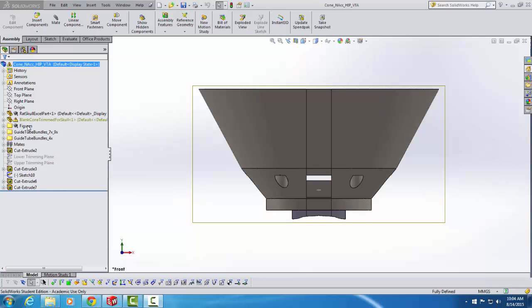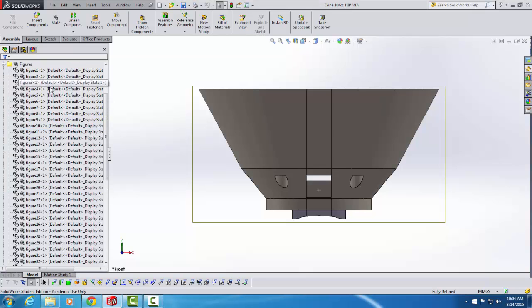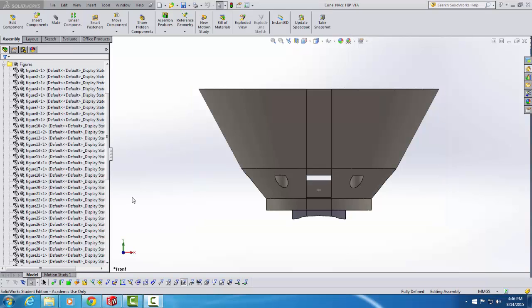And you can see that there's a folder here called Figures, and if I click on the plus to expand that, you see that this template file actually contains low-resolution reproductions of all of the coronal plates from the Atlas of Paxinos and Watson. These are not intended to be used as a replacement for the Paxinos and Watson Atlas. I highly recommend that you purchase your own copy of the Atlas because these are low-resolution images. But using these will be very helpful for designing your targeting cone and deciding where your probe trajectories should be placed.